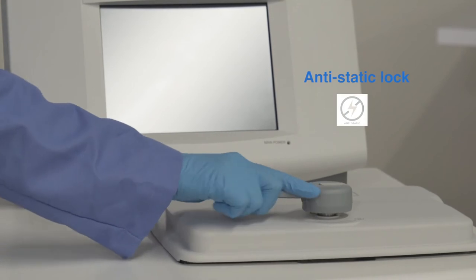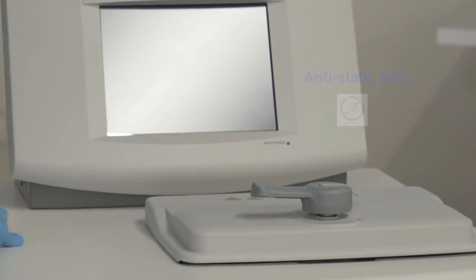In order to unlock the retort after the unit has been started, the user will need to pause and wait for the unit to unlock before trying to open the handle.